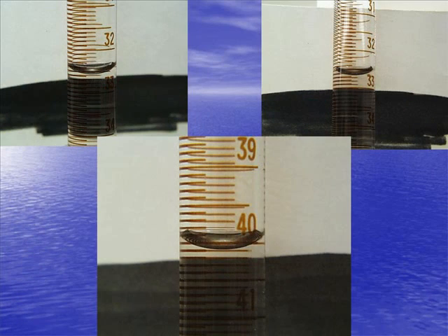Be sure to read the burette correctly. Read the burette at eye level. Too high is on the left, or too low is on the right, and you will have errors. An index card with a dark line held behind the burette makes reading easier. Be sure to record the correct level of precision: two decimal places.